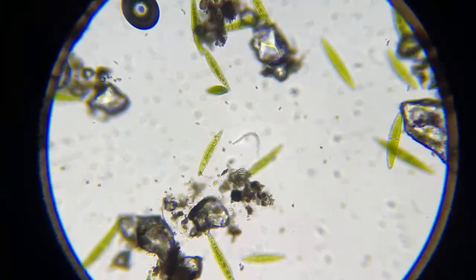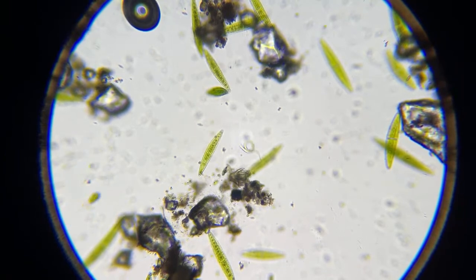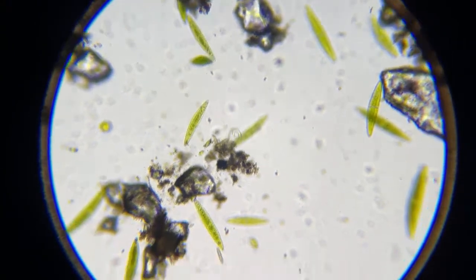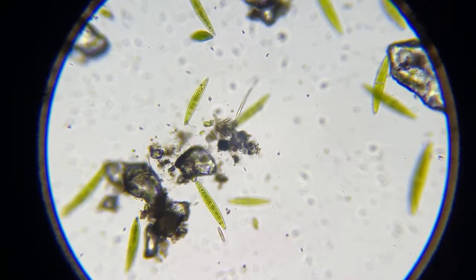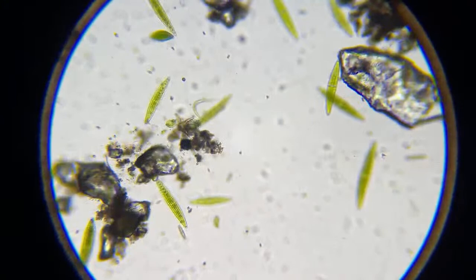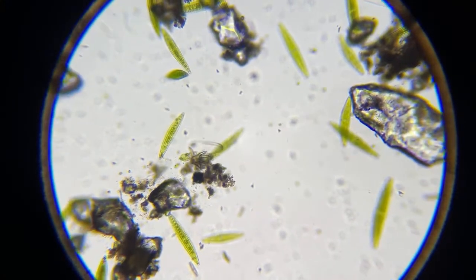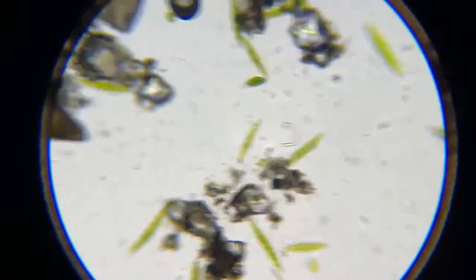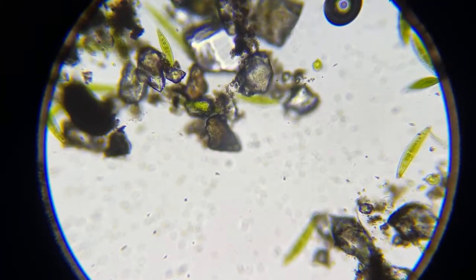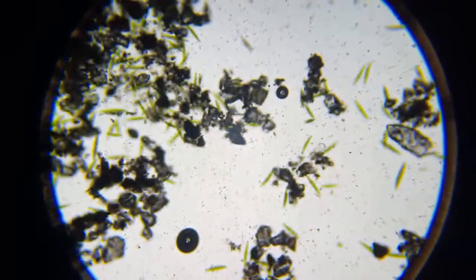There's our hookworm. And whenever you dig in a mud puddle, you're going to get hookworms, okay? If you dig in mud or if you're working in your garden or anything, that hookworm is going to get on your fingers and everything else. But if you have a good immune system, nothing's going to happen to you. You don't want to be putting them in your mouth.